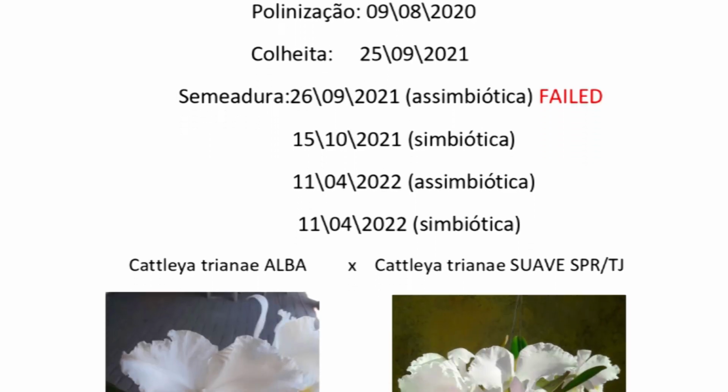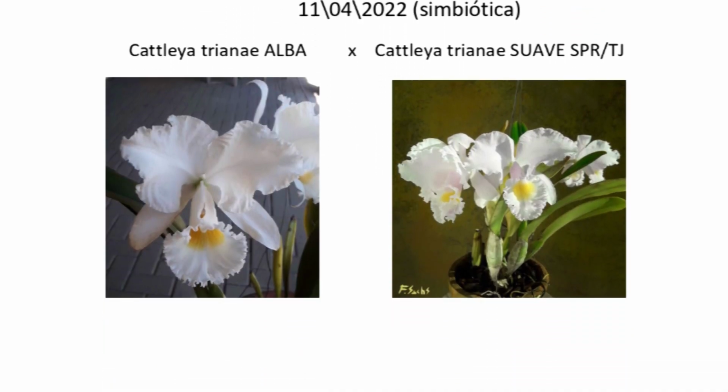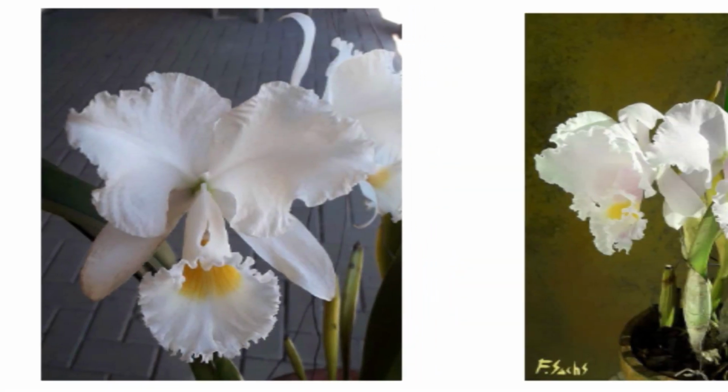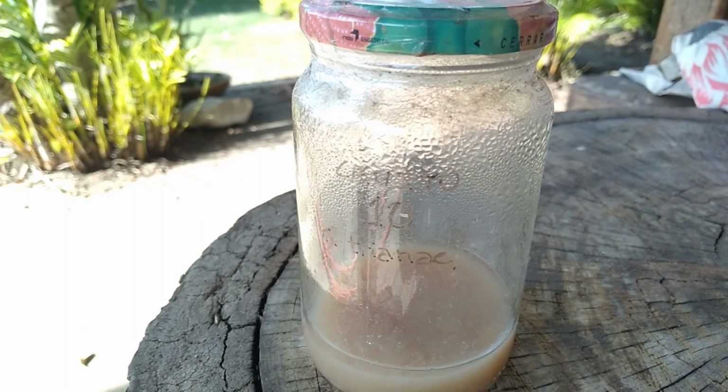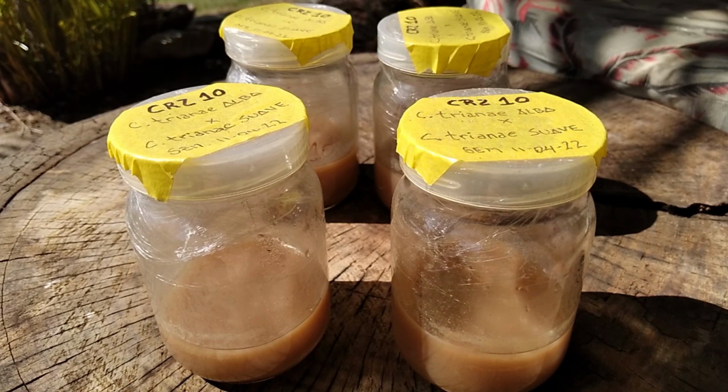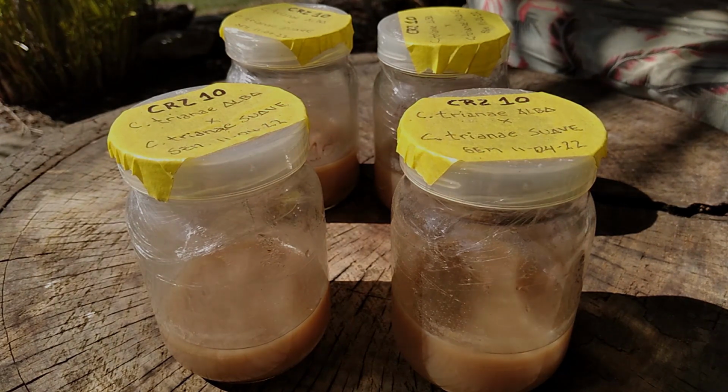But by far the most frustrating was crossing number 10. Ironically, it's the one I showed you here in episode 6 of this series of videos. Quite a few months after sowing, even with no contaminated jars, there was no germination at all. At first I thought it was because I had to share my attention between recording and doing the procedure. I think the seeds ended up staying in the disinfection solution for longer than ideal. So I tried seeds from the same fruit a second time, very carefully. But it's past its 5th month and nothing. I believe these are just sterile seeds.